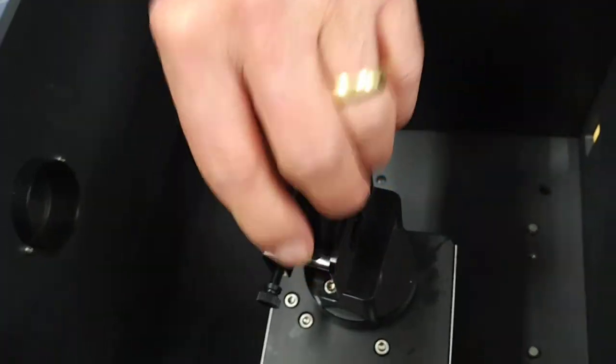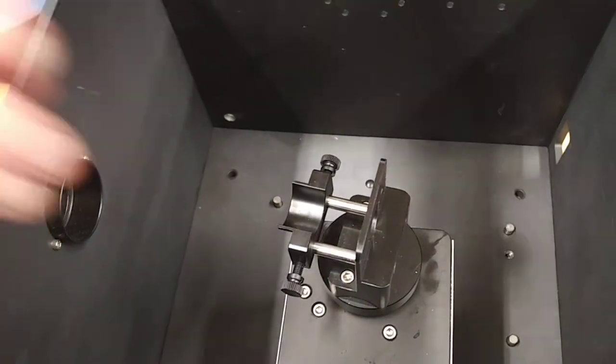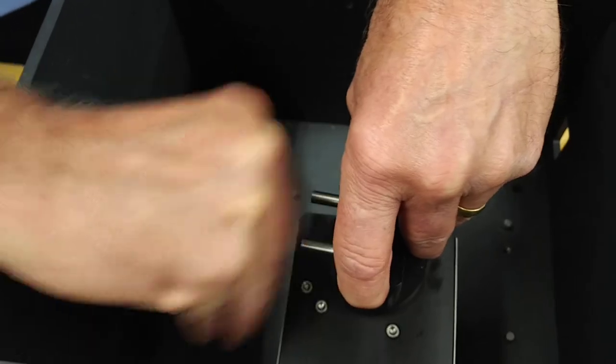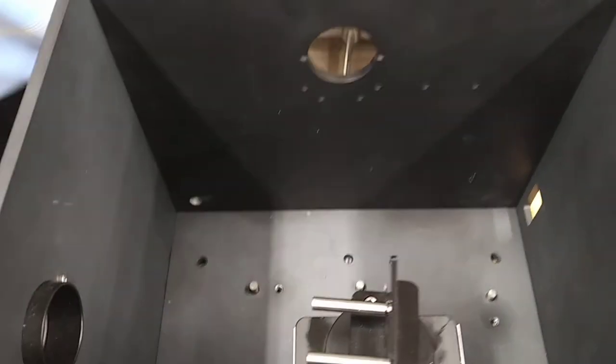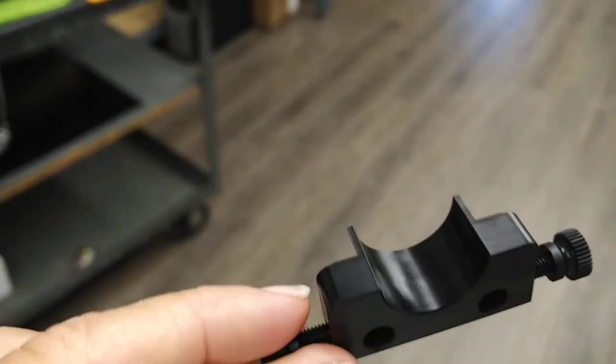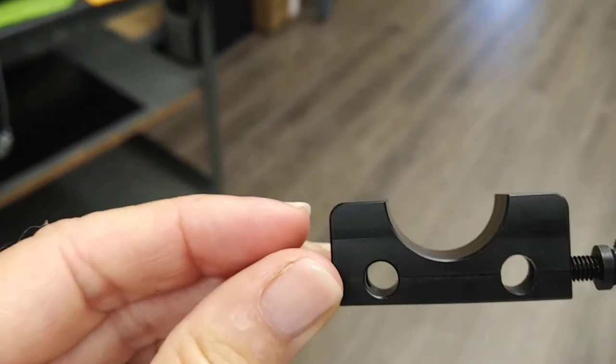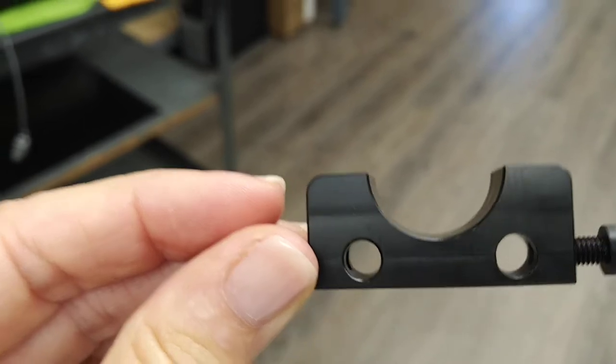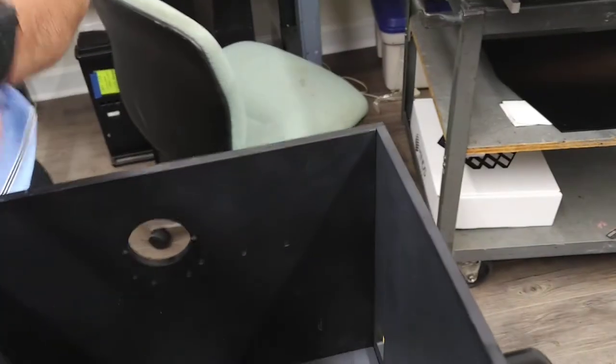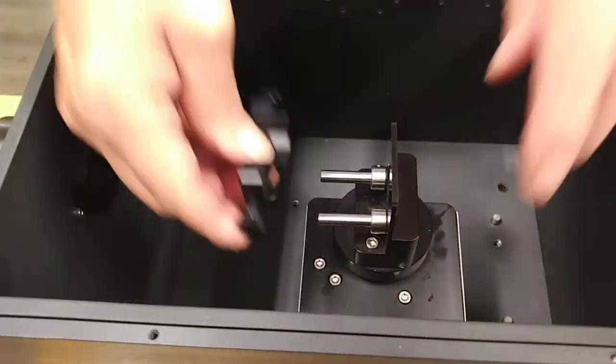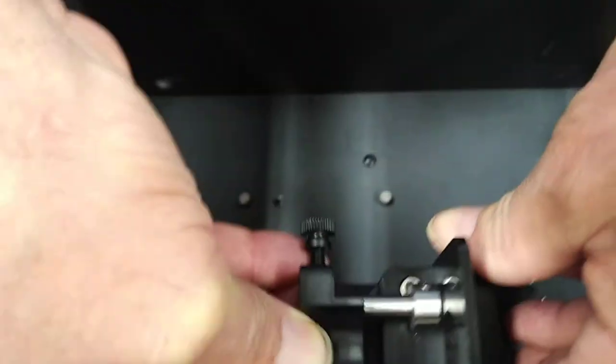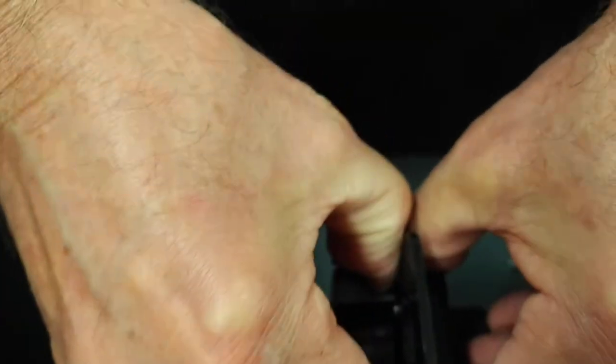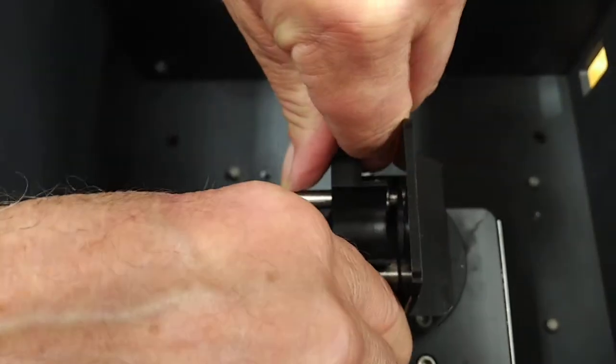I'm going to transition to a smaller diameter. Right, so now Rich is removing this block that is machined for holding the sample upright, either flat based or round. And now he's put two little screws on here to form a ledge for a round sample to sit. He's turned this holder around so now something round can be accommodated.